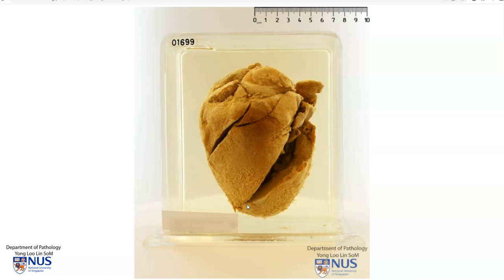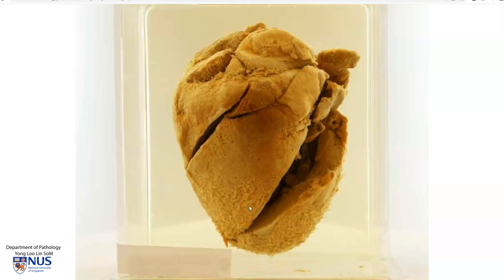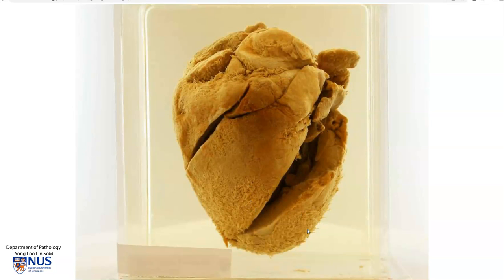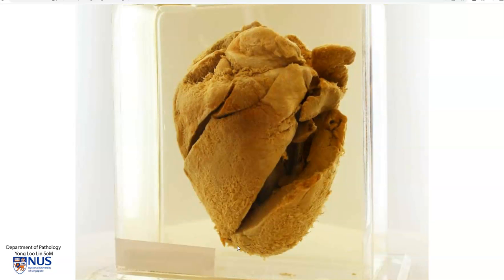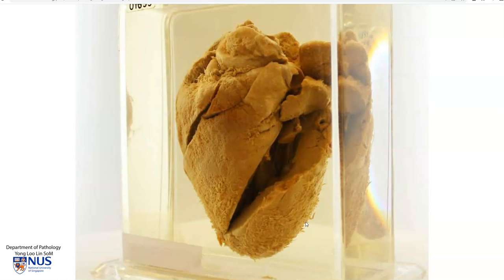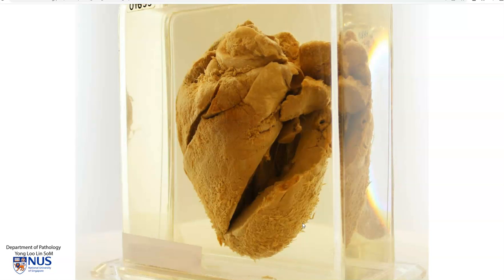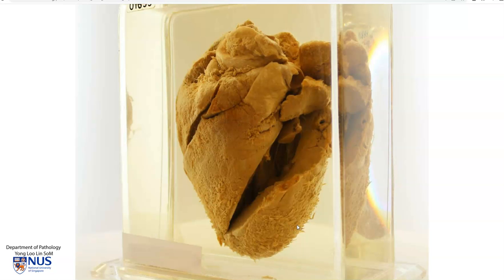However, here we have this very roughened appearance, and as I rotate the specimen and pay attention to the edges, it's almost got this rather strandy look — like there are little brownish tan strands that have been broken up.